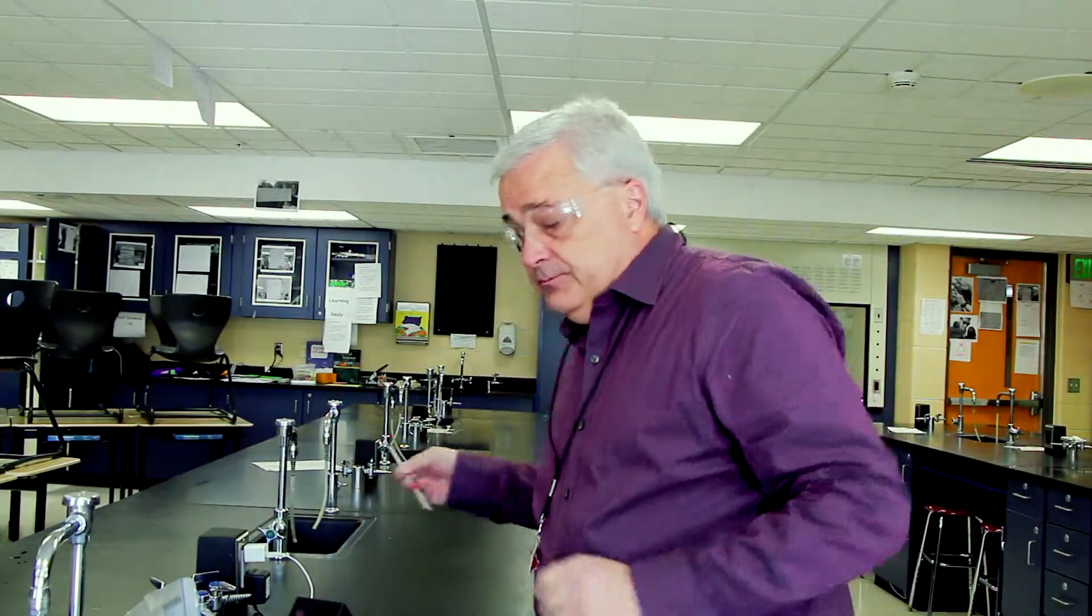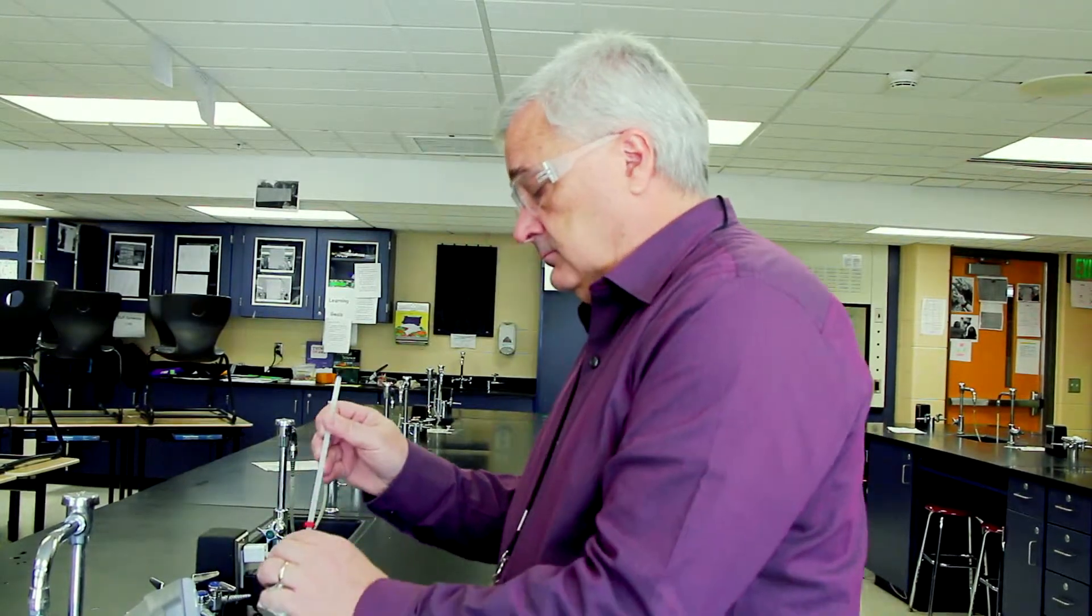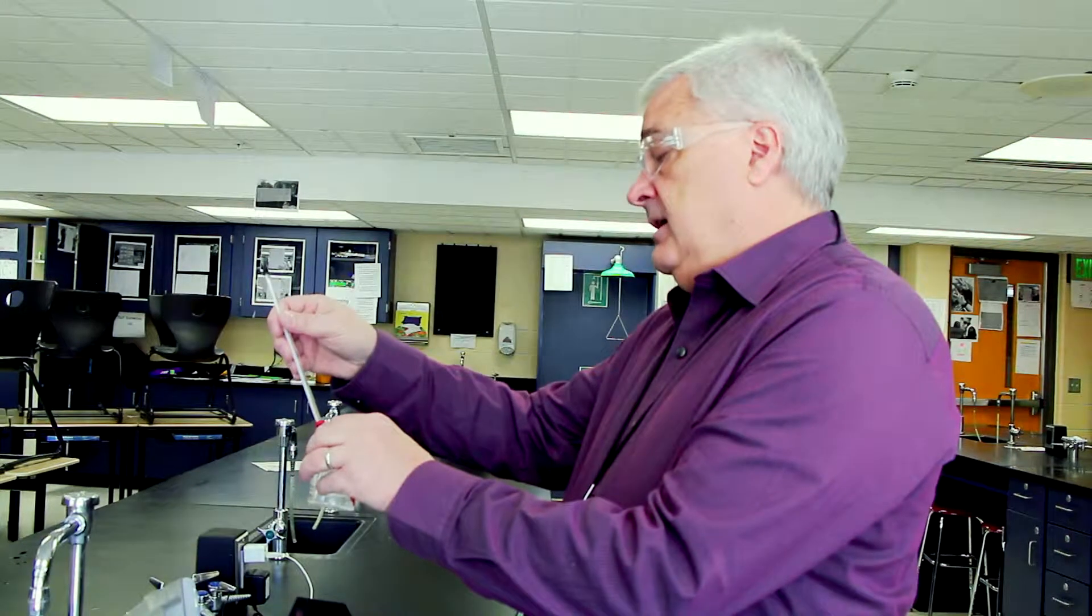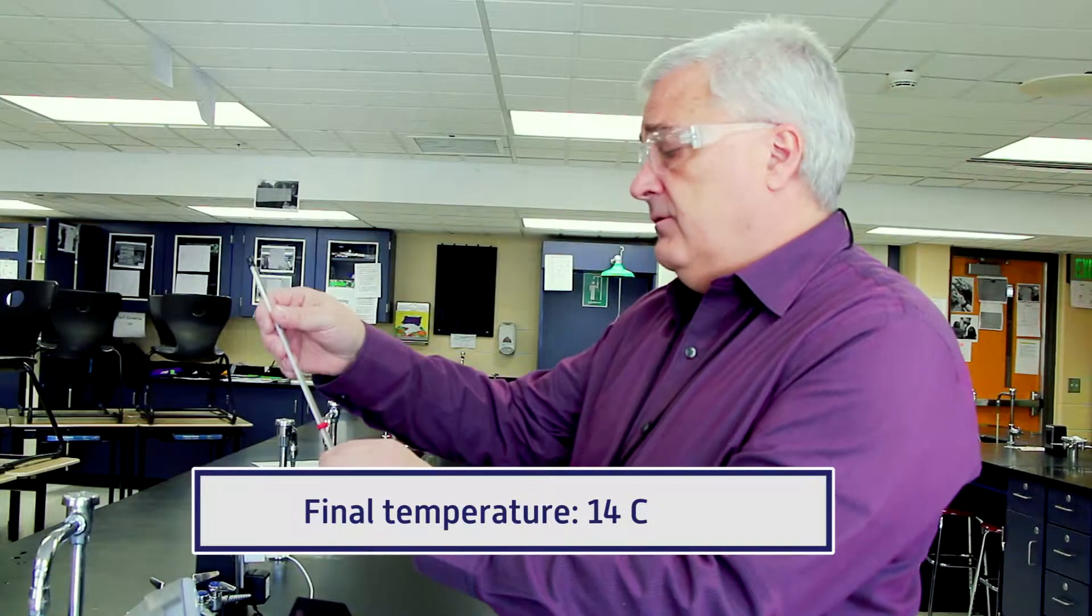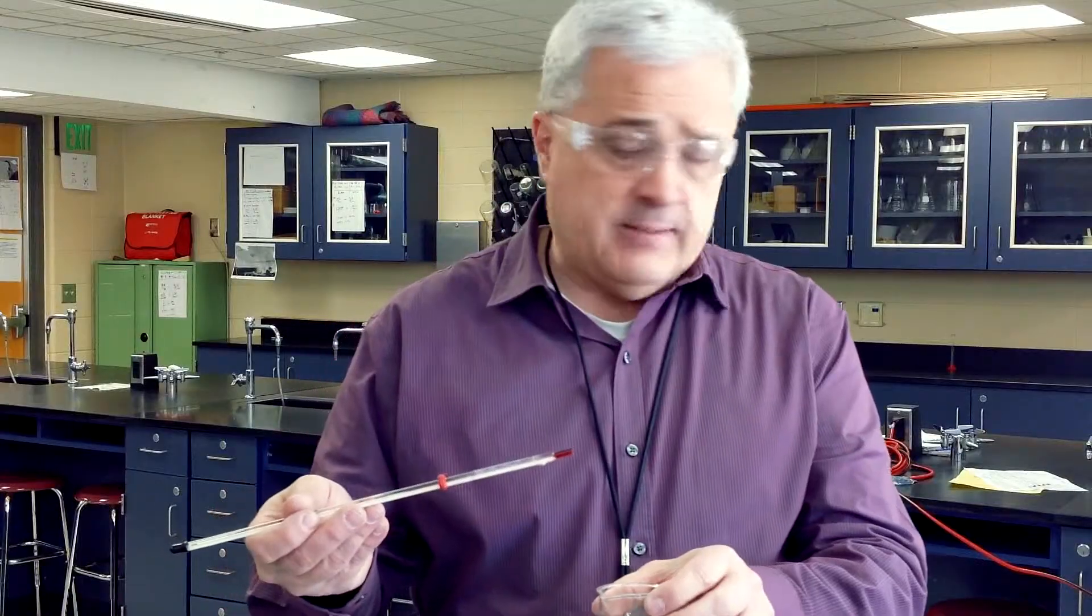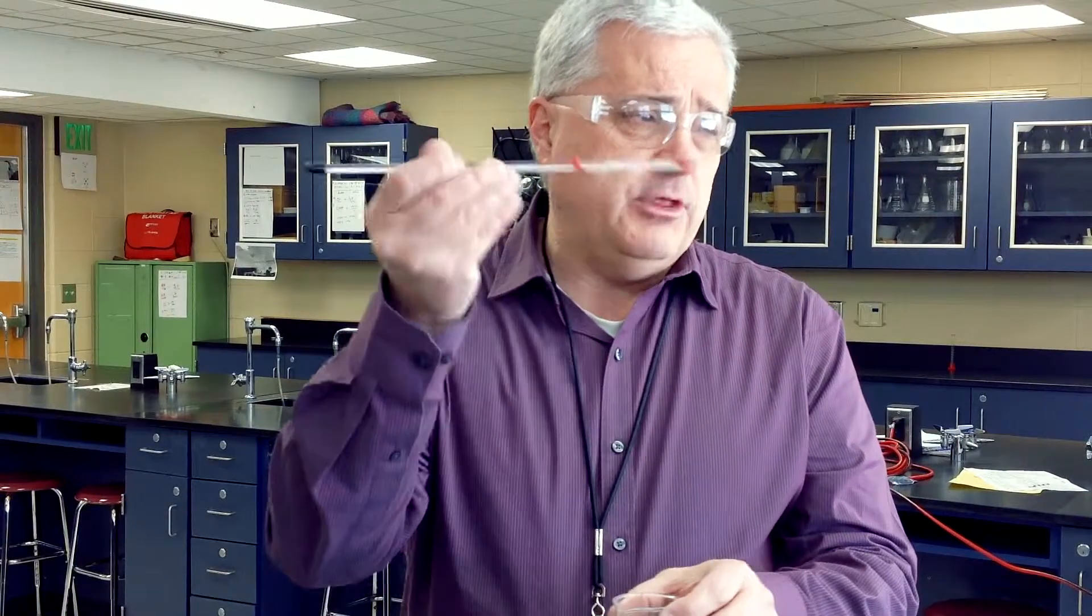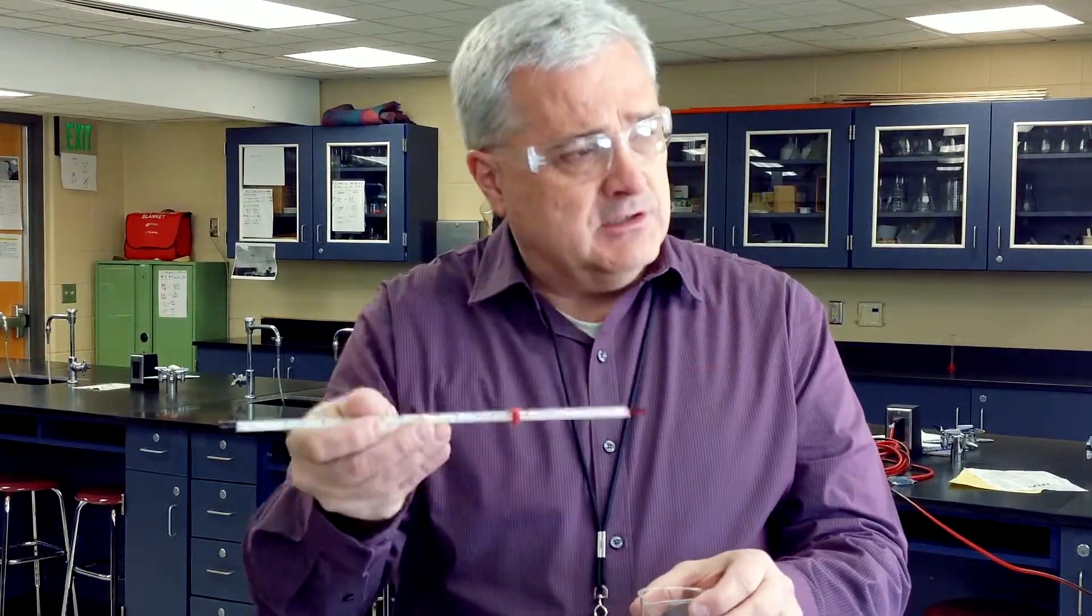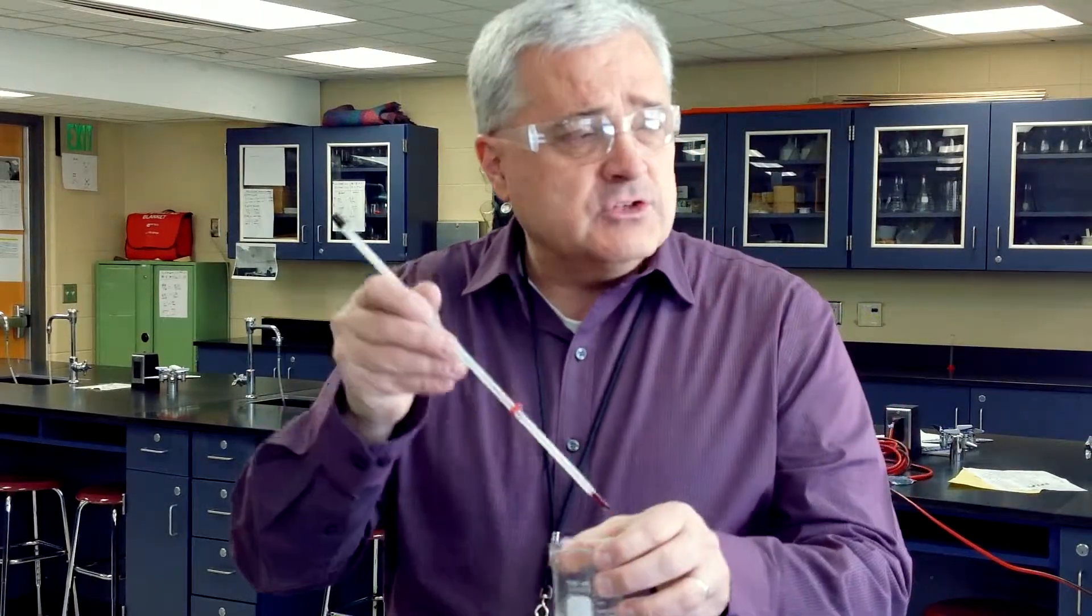While the reaction is winding down, we can take the temperature of the solution again. What we find is a temperature loss of about four degrees Celsius. Now we're not doing any calculation with the temperature change, it's just an interesting observation. Also, a lab thing that you really have to think about: you never stir with a thermometer because a thermometer is glass and it's not meant to be a stirring tool.